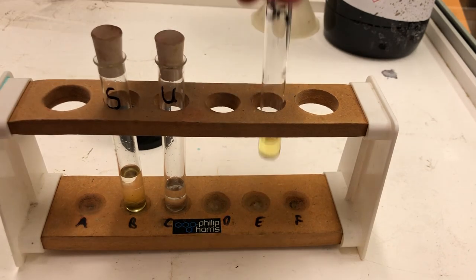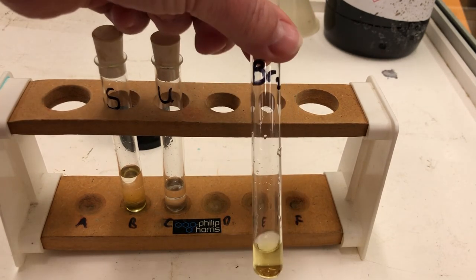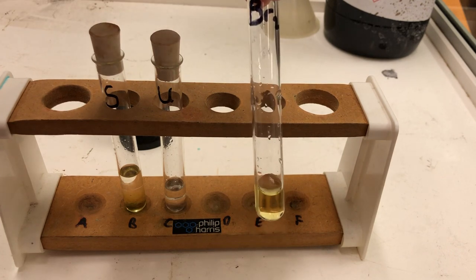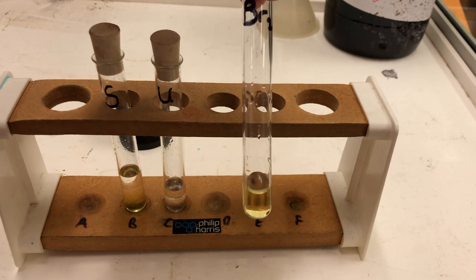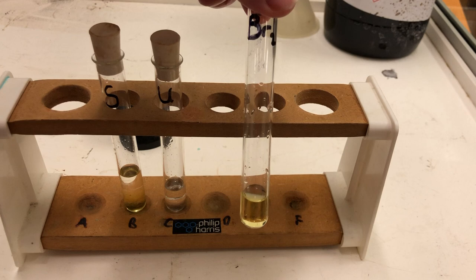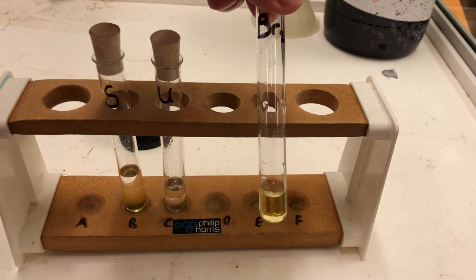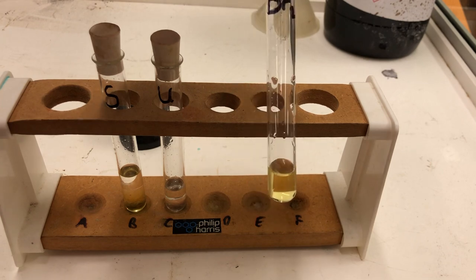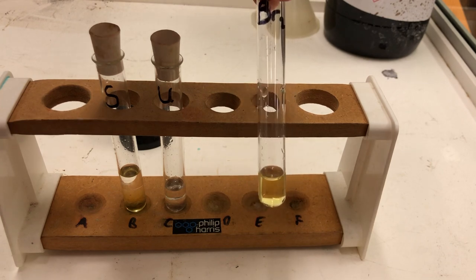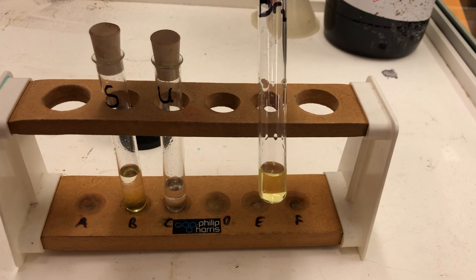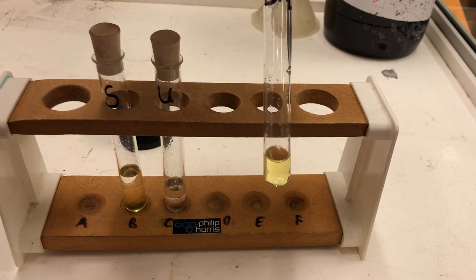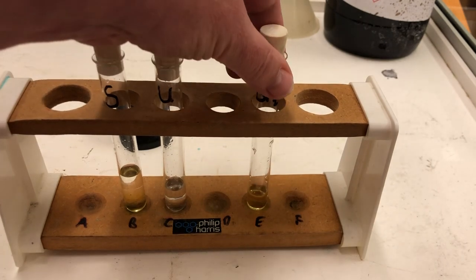The bromine was originally this pale yellow color. It's a very low concentration of bromine water for safety. If it's a higher concentration it would be orange, or if it's pure bromine it's a foul-smelling brown liquid. You will have seen we were wearing rubber gloves when we were handling the bromine water. We also used a fume cupboard because bromine is a toxic element.